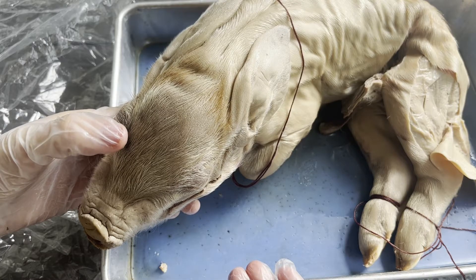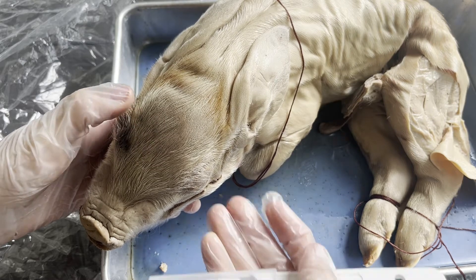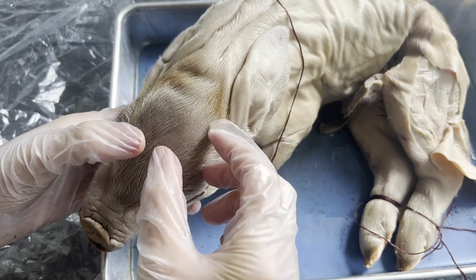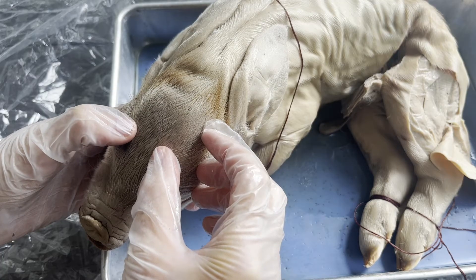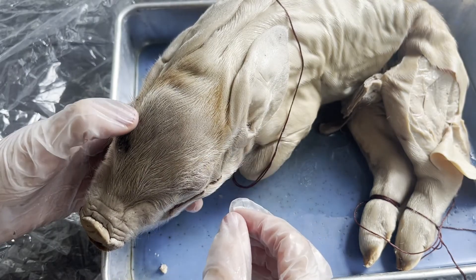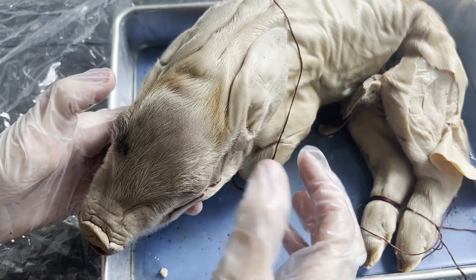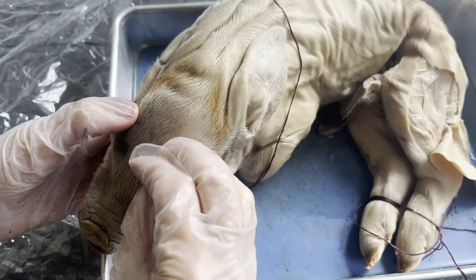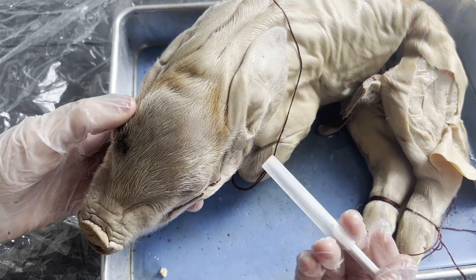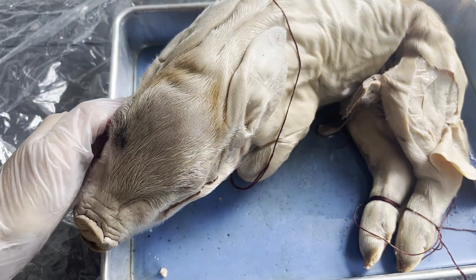Brain tissue is very heavy and very high in adipose, or fat, tissue — so it's very sensitive and breaks really easily. You would want to look at the brain just for curiosity. You'll probably be able to see the left and right cerebral hemispheres, the gyri and the sulci. But beyond that, you're not going to be able to identify a lot of detailed brain anatomy because it is so sensitive. Some teachers have said when they opened it up, the brain was almost like a goop with not much form. So if you do want to look at the nervous system, use your wisest judgment when using the scalpel to cut the skull open — for a lot of pigs, it's not a good idea.